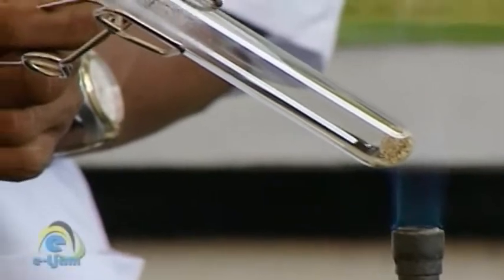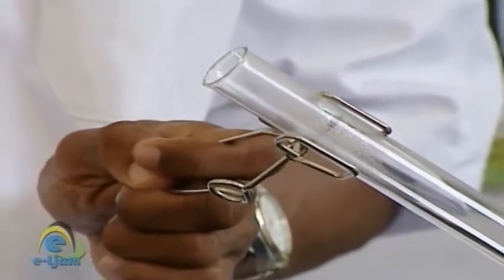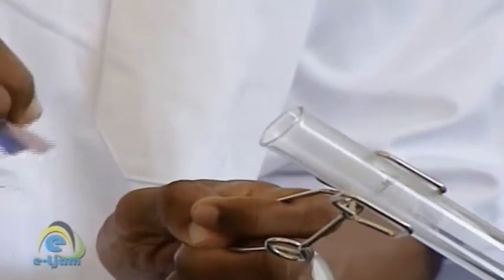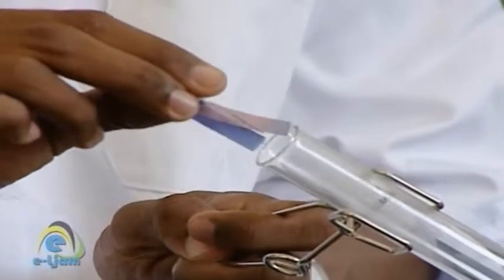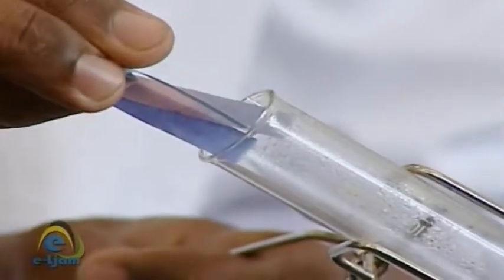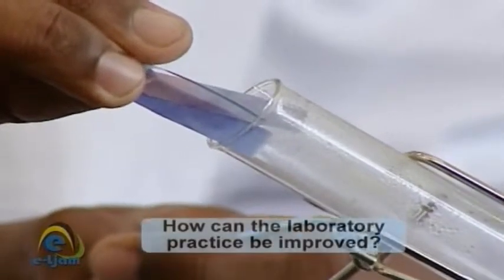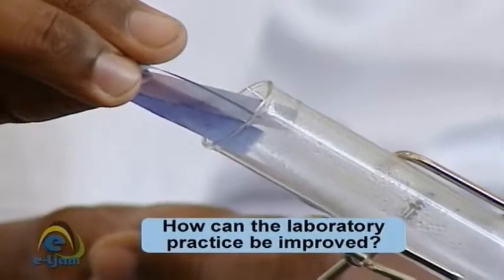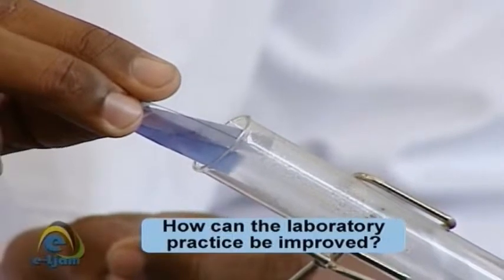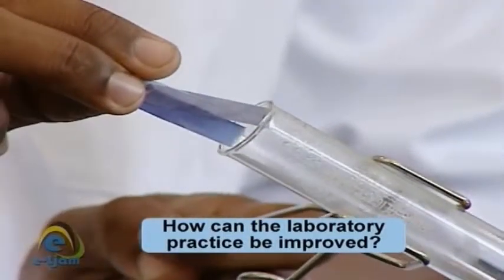Test: heat a small amount of Y in a clean, dry test tube. Test any gas given off with cobalt chloride paper and red and blue litmus paper. Observation: colorless condensate forms near the mouth of the test tube that turns blue cobalt chloride paper pink. Inference: condensate is water, and therefore Y most likely is or contains a hydrated salt.